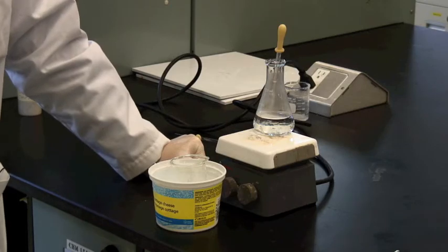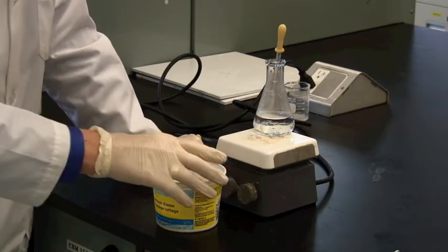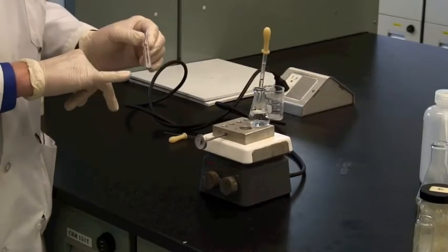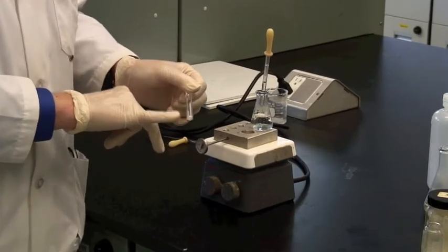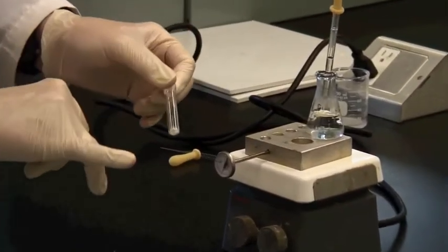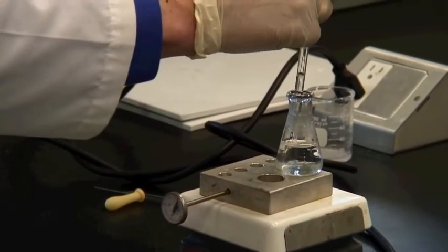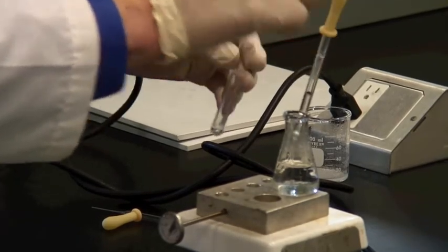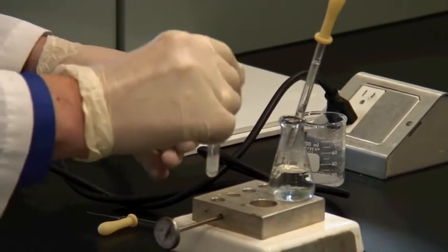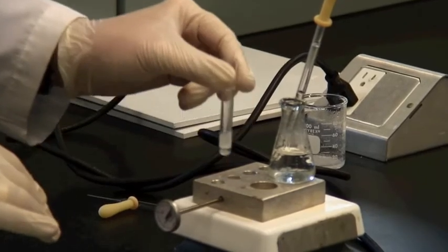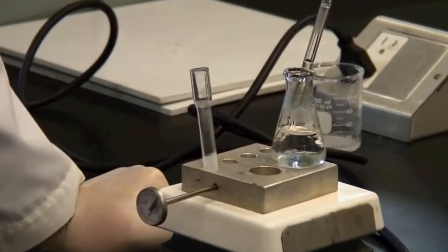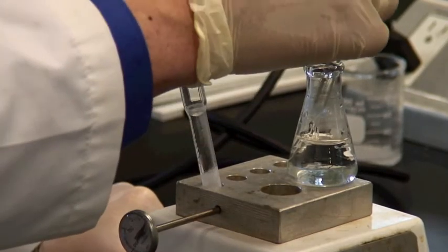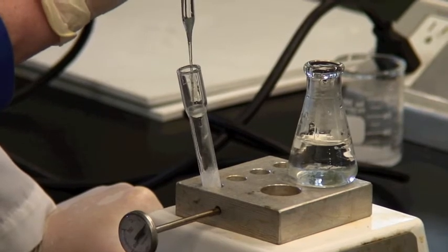Let's move on to microscale crystallization, which is using equipment that you haven't seen before. So I now have my solid to be recrystallized at the bottom of a Craig tube and some boiling solvent available. So we put a little bit of hot solvent in there, shake it up to dissolve, and it sits in one of these wells. This isn't going to dissolve immediately, but let it come up to temperature. And if it hasn't gone into solution, add a little bit more.